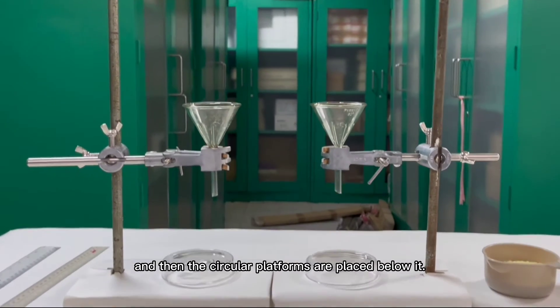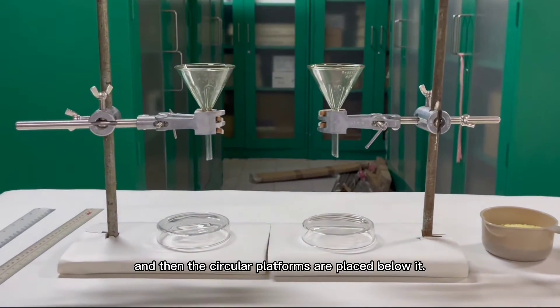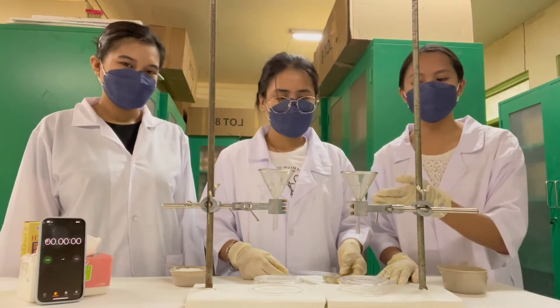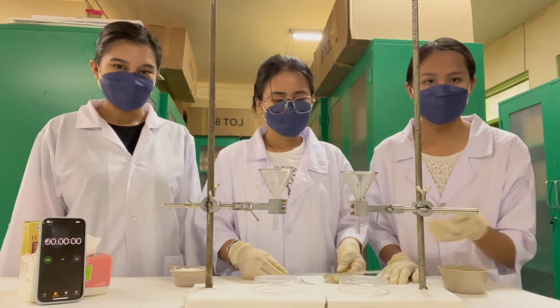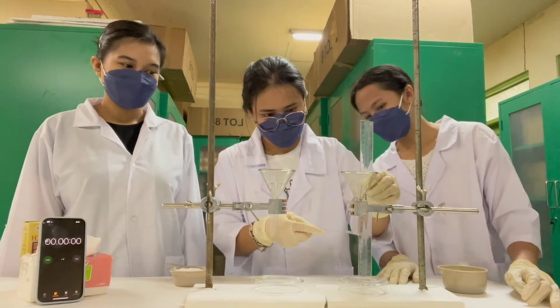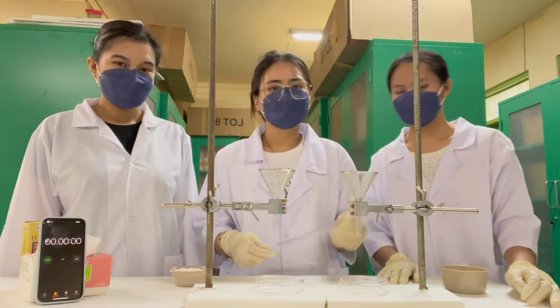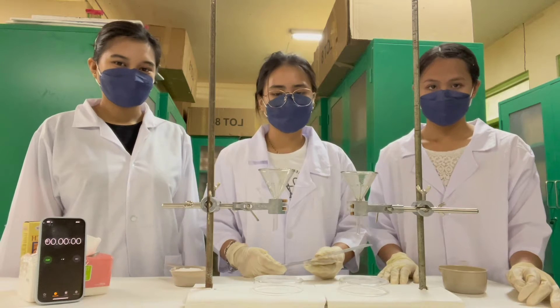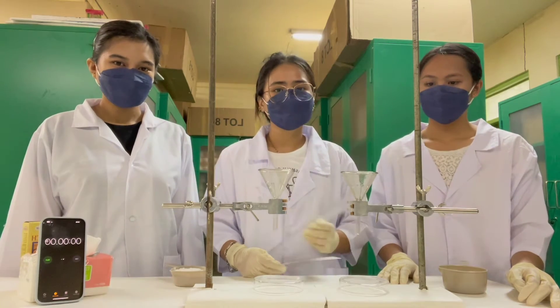For the setup, the funnels are clipped onto the iron stands and then the circular platforms are placed below them. Let us begin. The first step is to measure the height of the funnel to the circular platform. For this funnel we have a measurement of 8 centimeters.